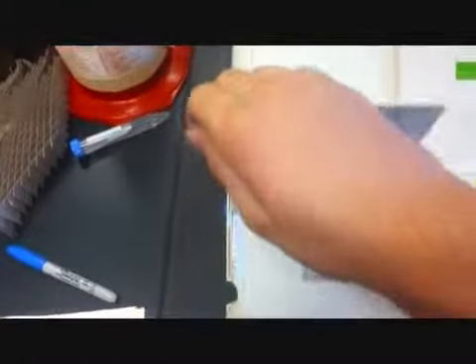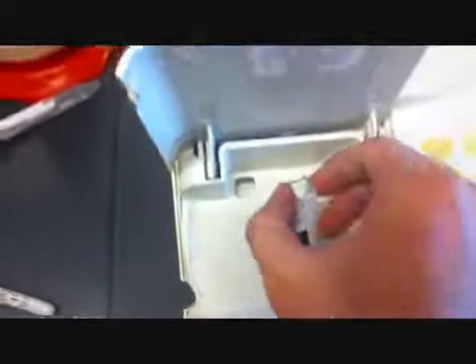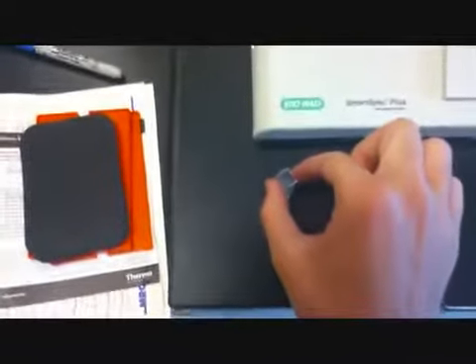Sugar. Okay, so I'm going to try to do this with one hand now. You open the lid. You have to grab it at the sides because the sides are rigid, and it has to be clear for the spectrophotometer to read it. Gotta fix this here.